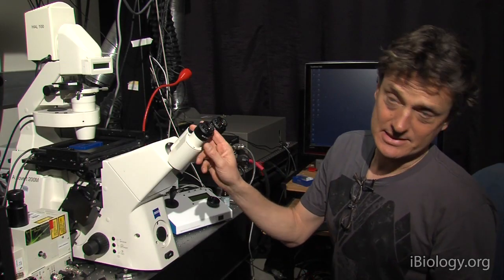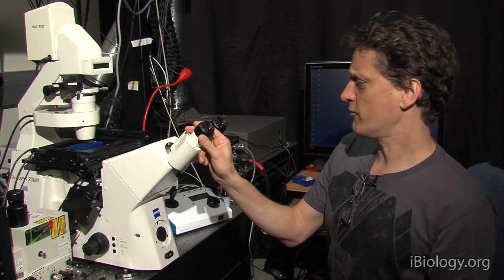Okay, we're going to talk about eyepieces. This is often a neglected part of the microscope.